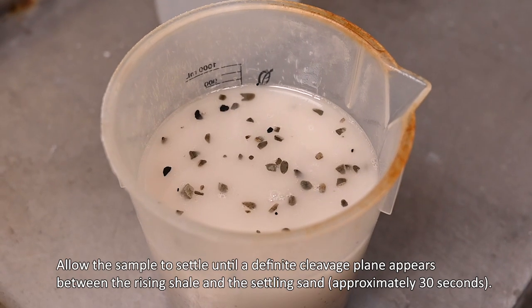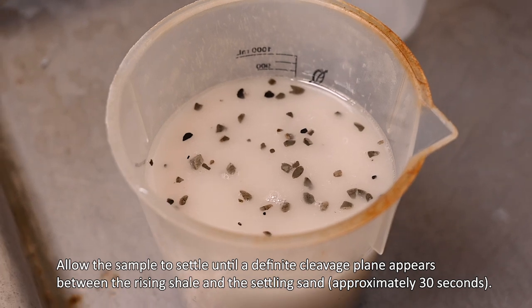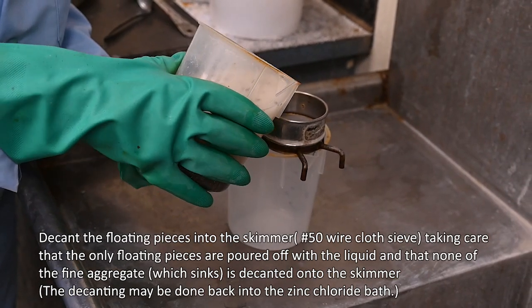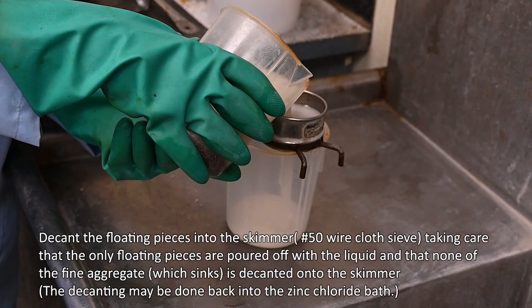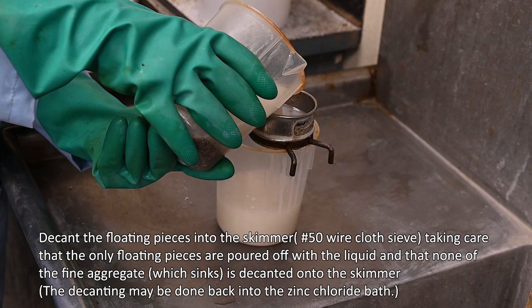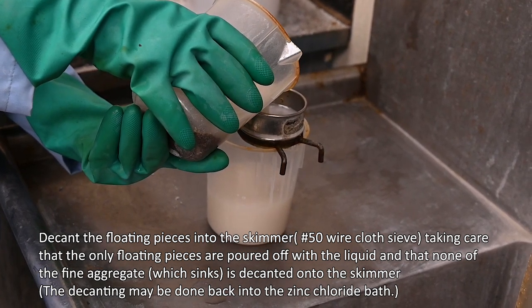Allow the sample to settle until a definite cleavage plane appears between the rising shale and the settling sand, approximately 30 seconds. Decant the floating pieces into the skimmer, number 50 wire cloth sieve. Take care that only floating pieces are poured off with the liquid, and that none of the fine aggregate, which sinks, is decanted onto the skimmer. The decanting may be done back into the zinc chloride bath.